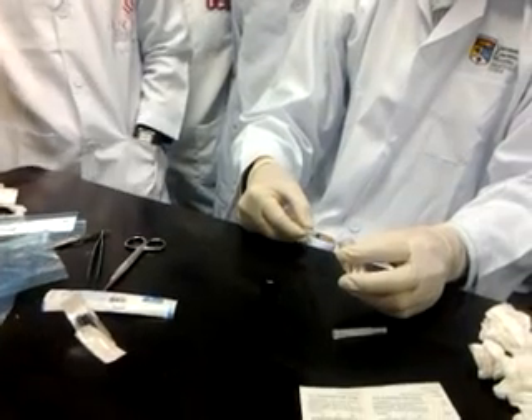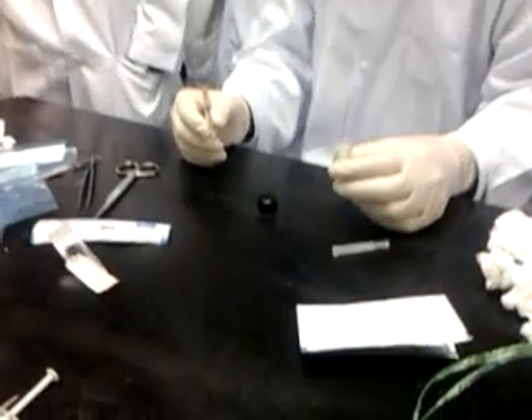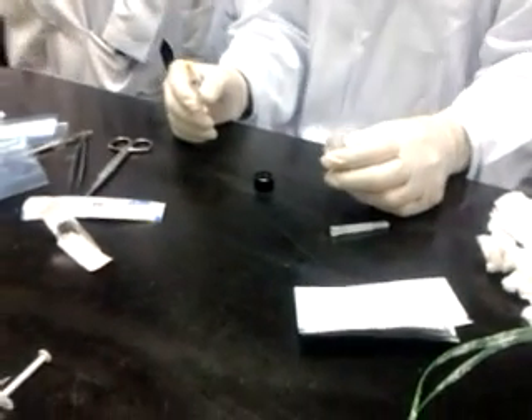Then you have to push it out. Remember the rat — what size of rat are you going to use? Can one of you weigh the rat and see what size it is? I want to prepare the rat. Okay, let's do it.